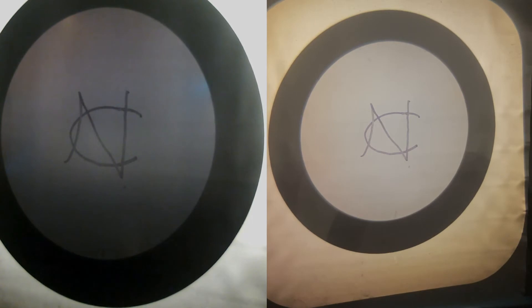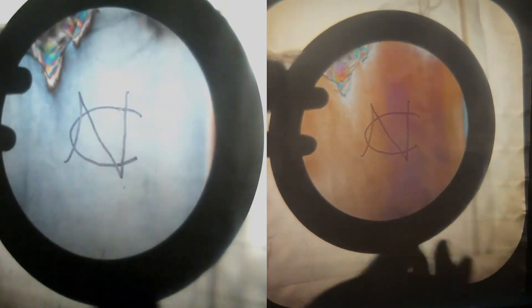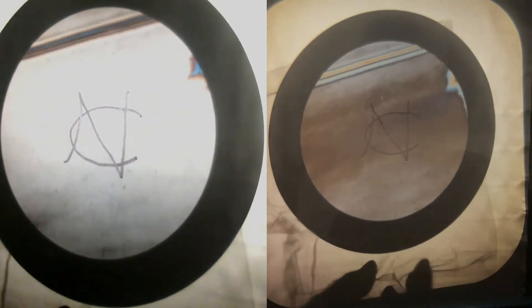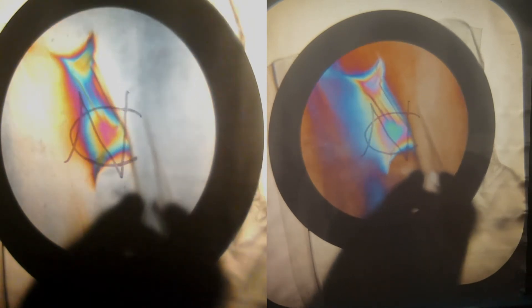There are other things besides acrylic — I've also got a cheap bag of plastic here. It is slightly polarizing in and of itself, but the interesting thing is when it's under tension, you see brilliant patterns emerge as I stretch it. It will relax, but as you stretch it more, you're aligning the molecules — the long-chain hydrocarbons in the plastic — so that they rotate polarized light. It becomes birefringent.